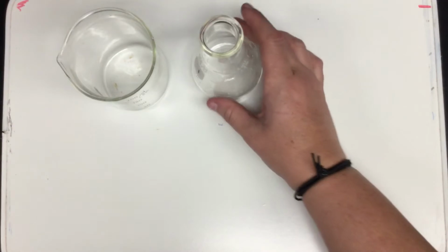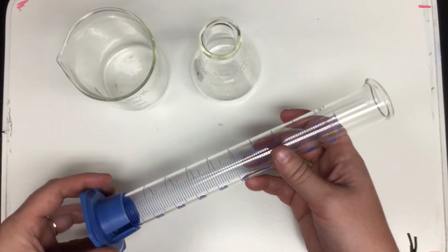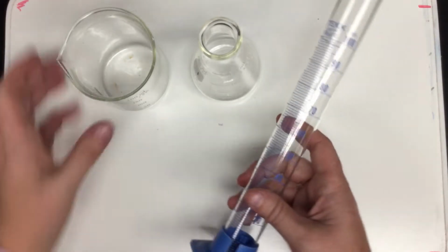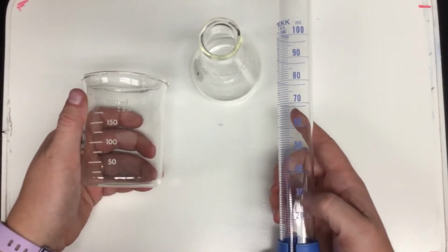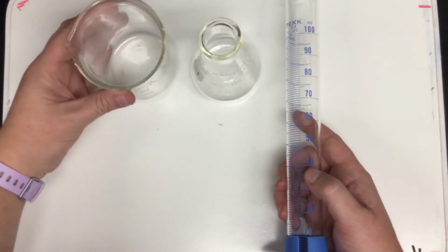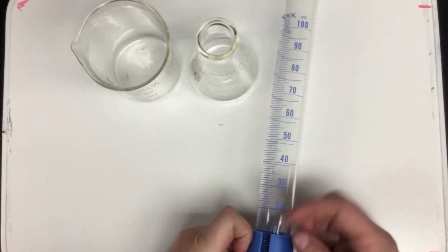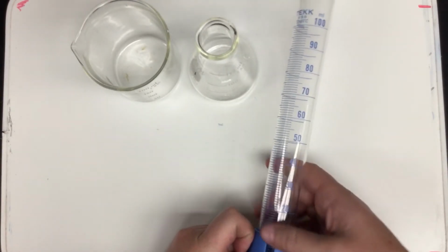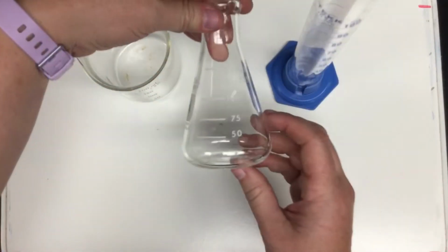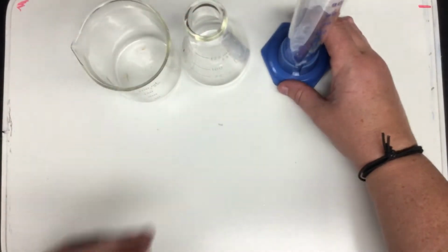Beakers, Erlenmeyer flasks, and graduated cylinders all can be used to measure volumes or to contain liquids, but if you look at the actual graduations and the numbers on the side, it should be fairly obvious that if you actually need to take a measurement of volume, the graduated cylinders would be your best bet, just because they have more lines and they're more equally spaced throughout, whereas something like a flask, because of its curved sides, it's a little harder to get an accurate volume in there.